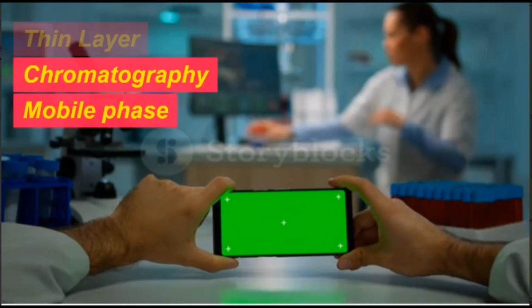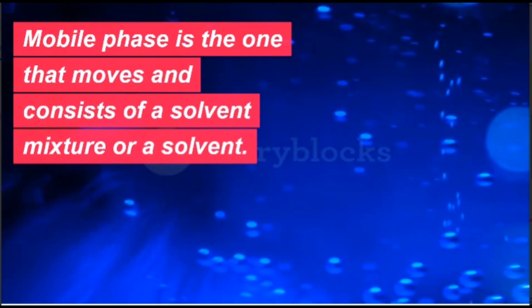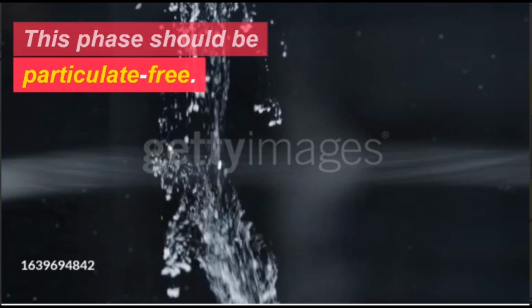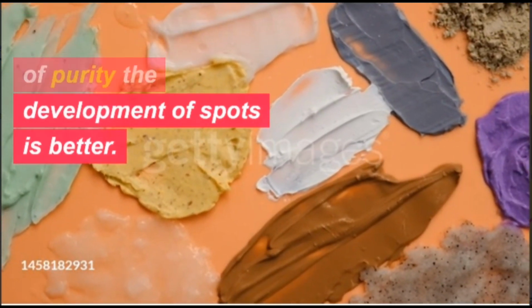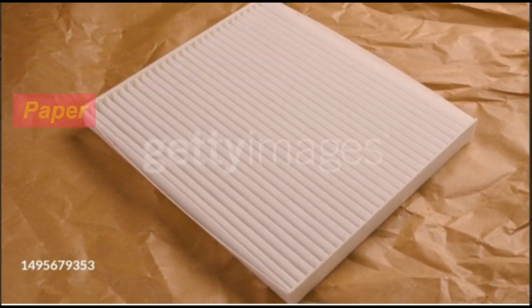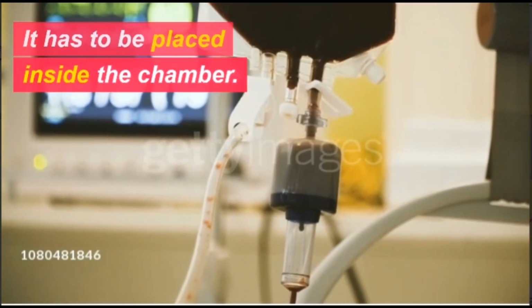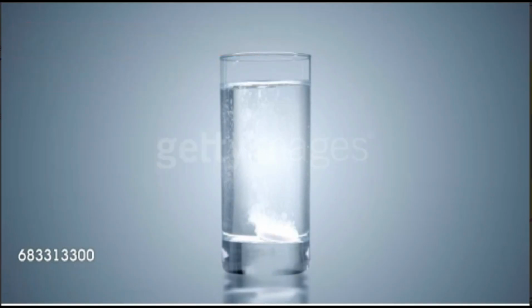Thin layer chromatography mobile phase. Mobile phase is the one that moves and consists of a solvent mixture or a solvent. This phase should be particulate-free. The higher the purity, the better the development of spots. Thin layer chromatography filter paper. It has to be placed inside the chamber. It is moistened in the mobile phase.